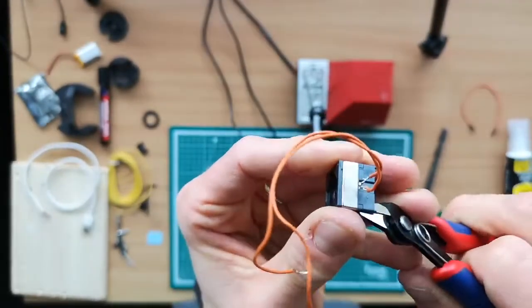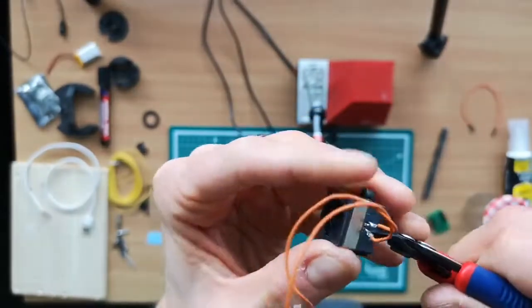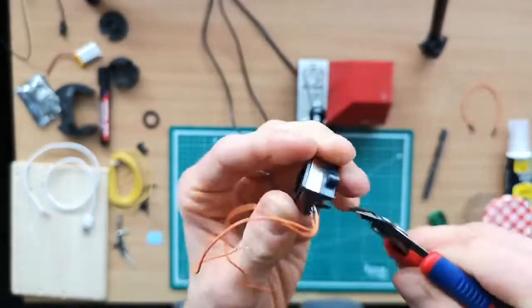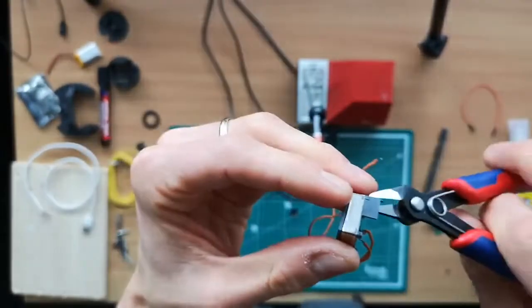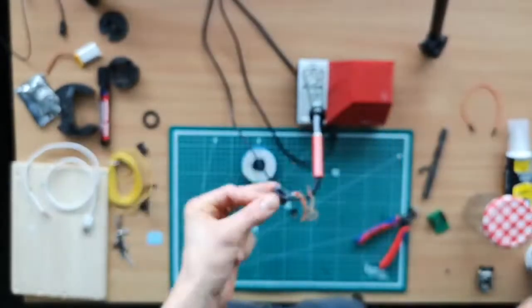One thing: this lens comes in two different variations, either with this base connected, or some don't have it. You can easily break it apart. It's just some very brittle plastic. So we just use pliers to rip it off. You have to be a bit careful with the wires, but other than that, I think it's pretty easy.